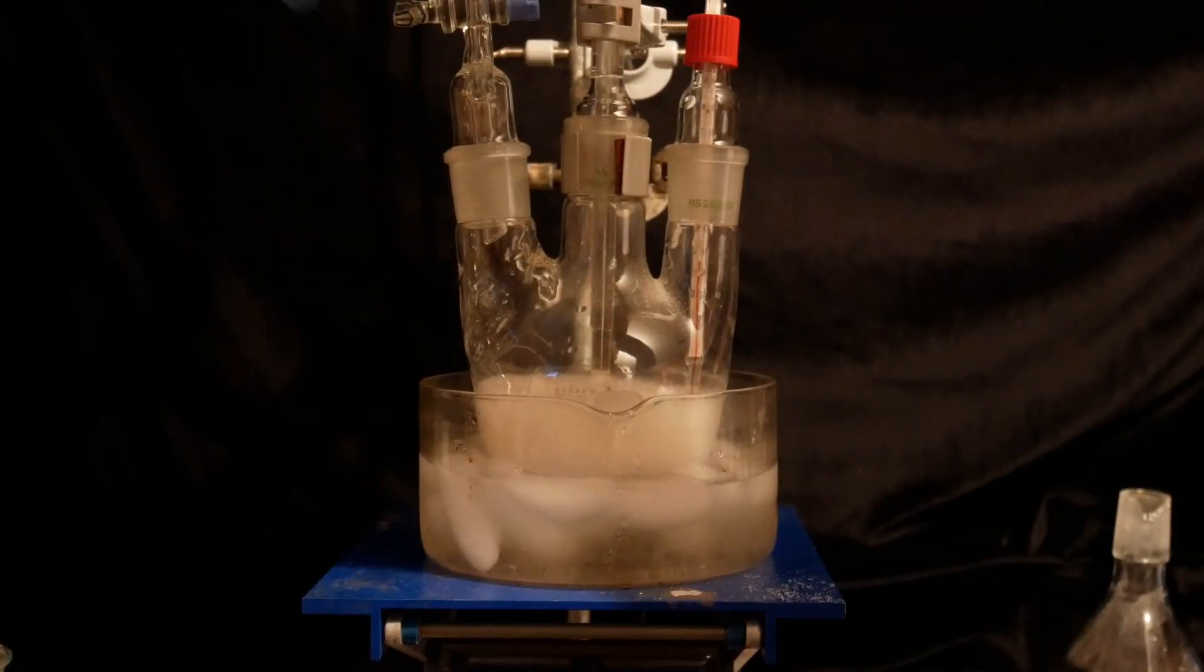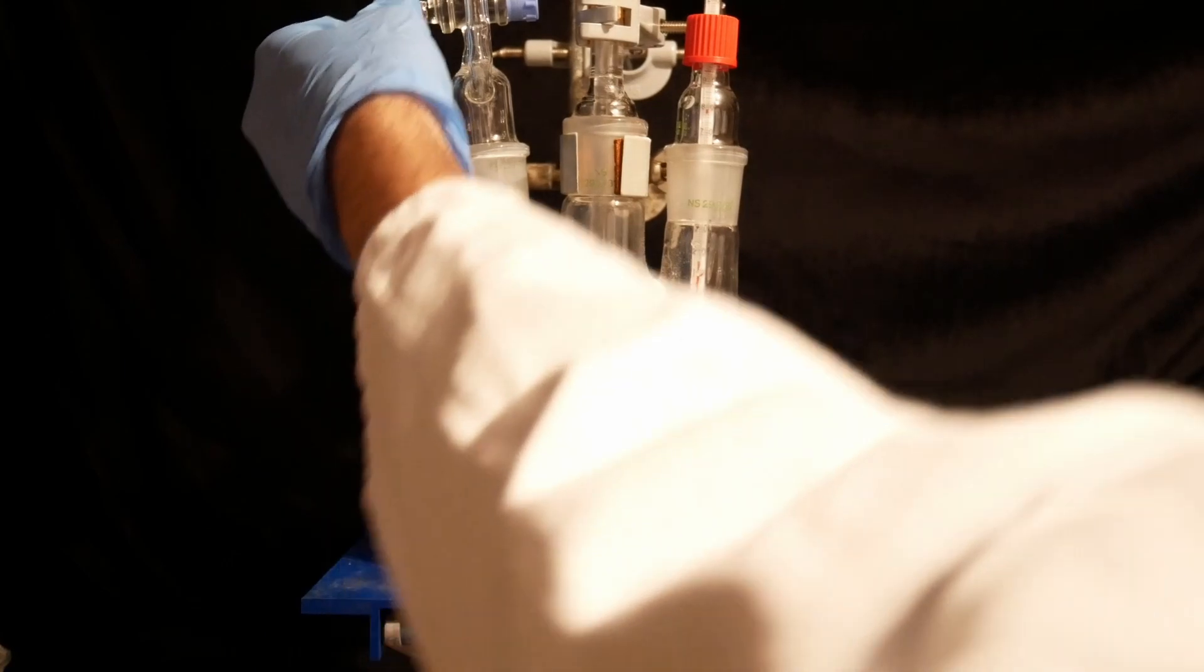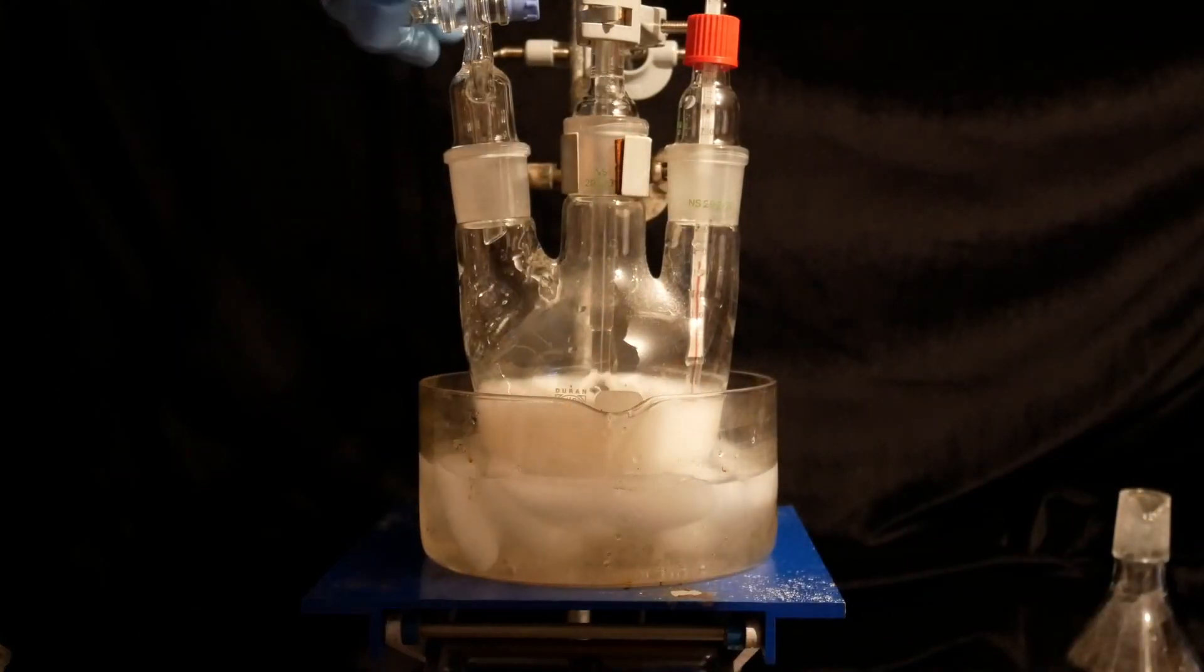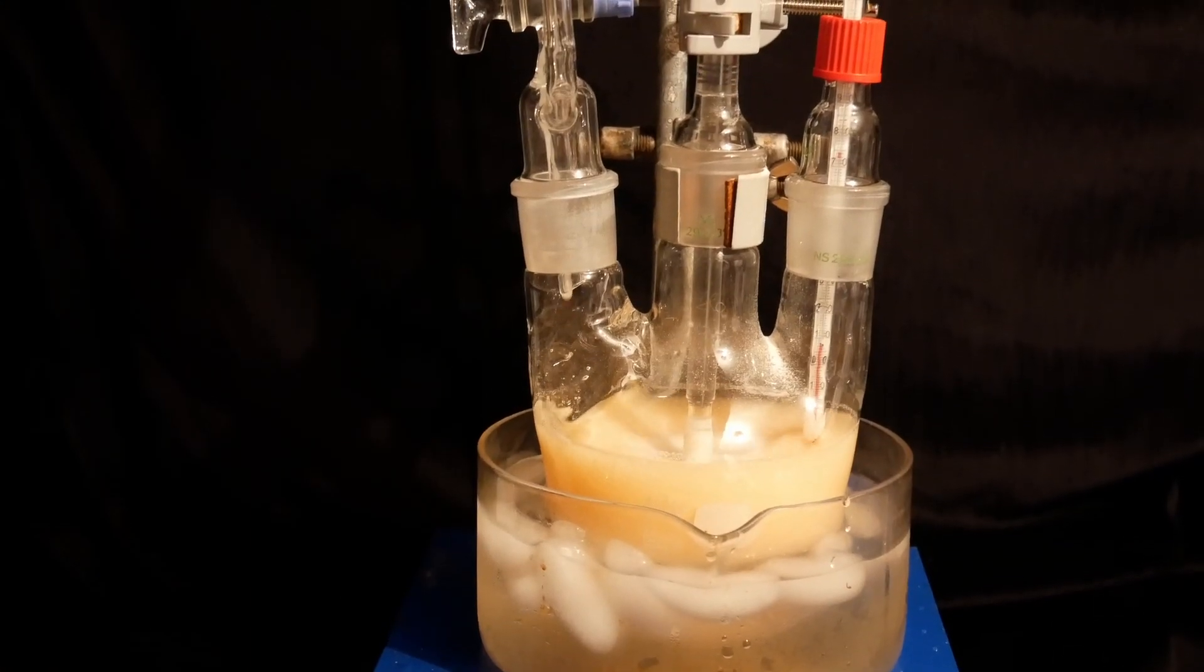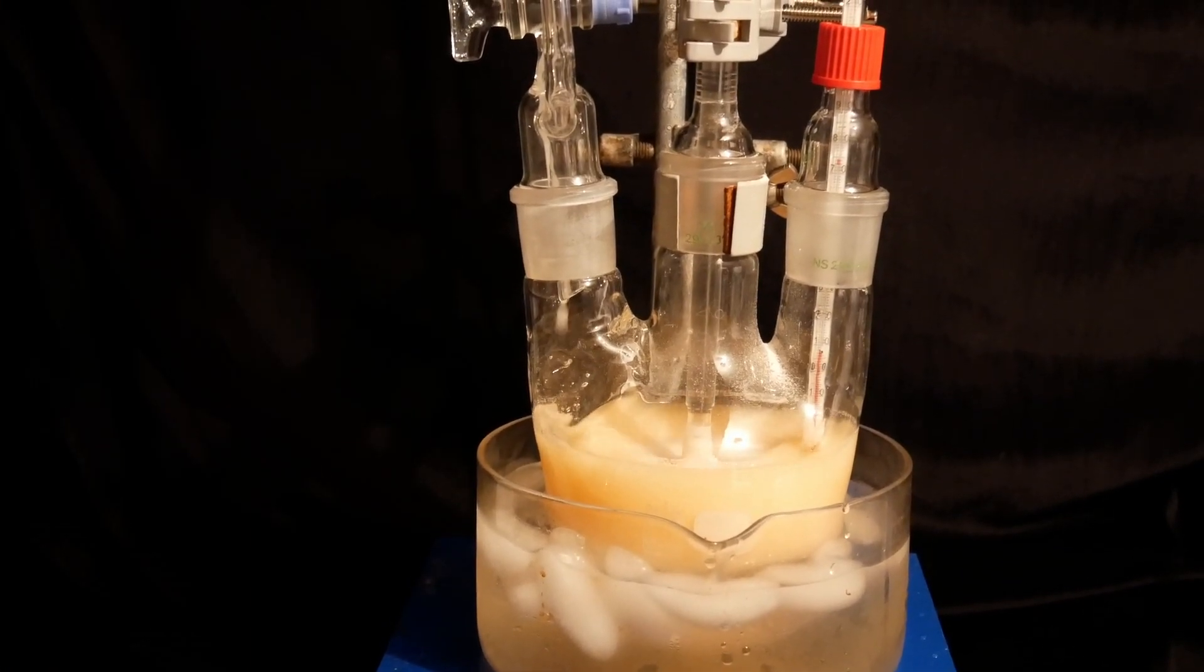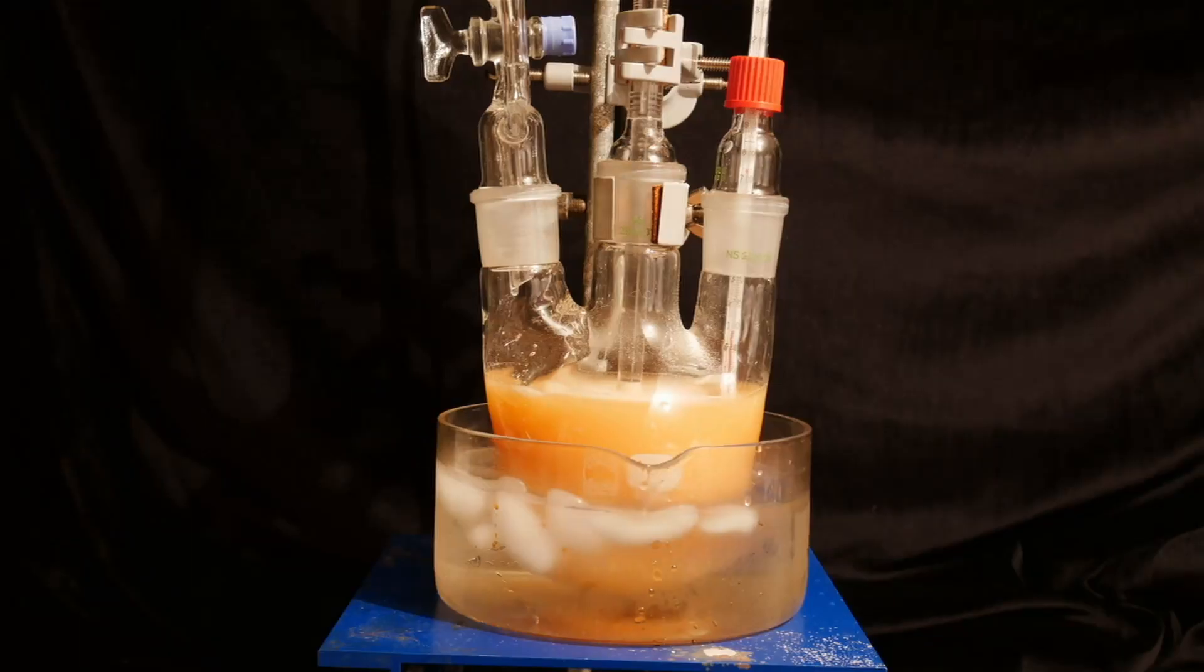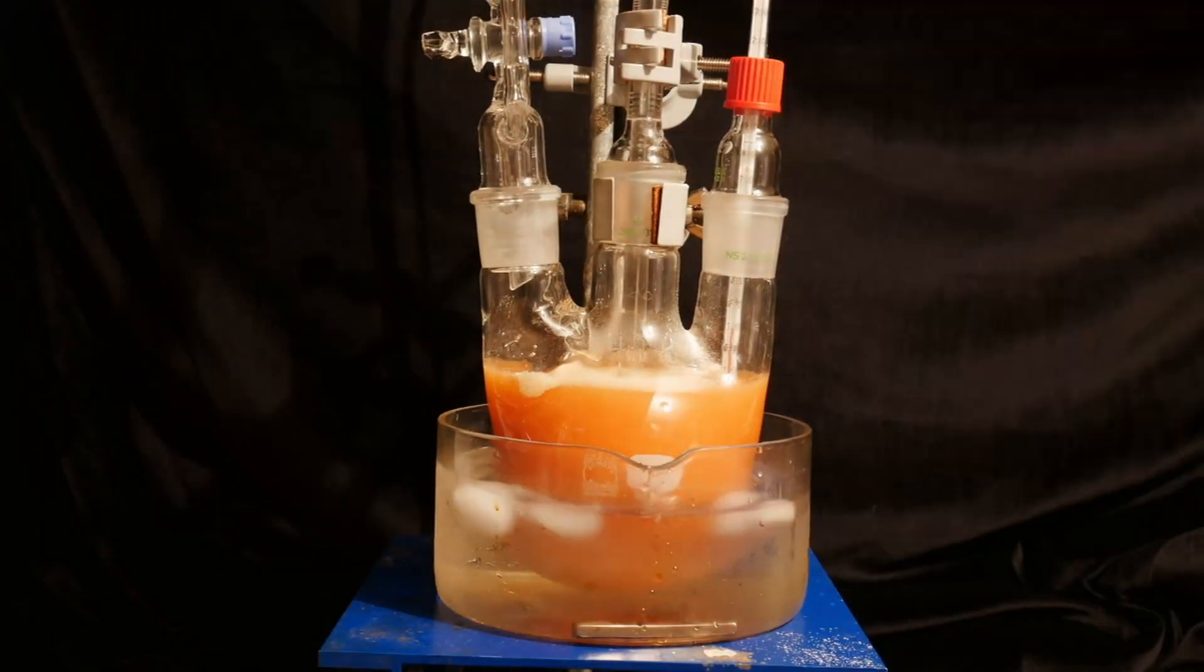Small bubbles can be observed forming in the mixture, which is due to the evolution of carbon dioxide gas from the reaction. This also indicates that the reaction has started. The mixture is now left to stir overnight, so we can sit back and relax and enjoy the reaction.